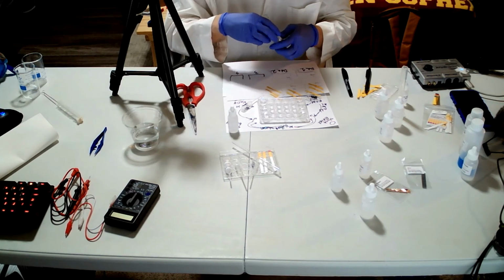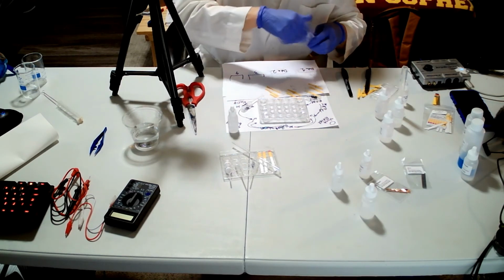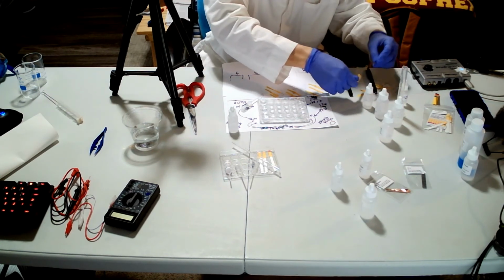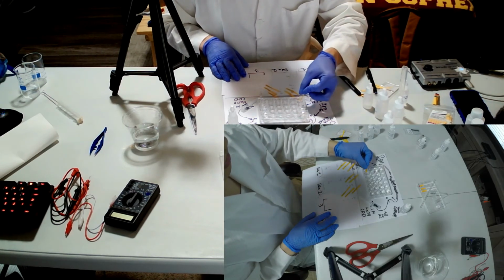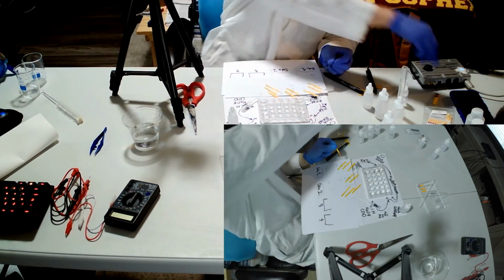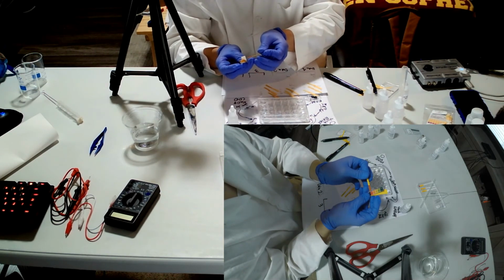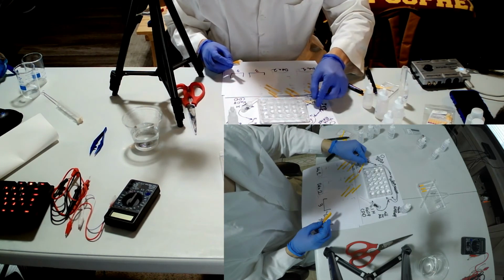For example, when you look at the pH of this diluted HCl, you see the color is a bit different. When you look at the chart, it is about pH 2, right? For this one.